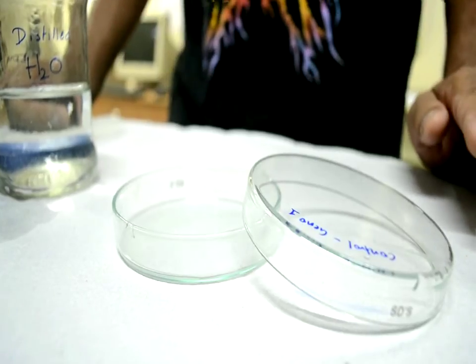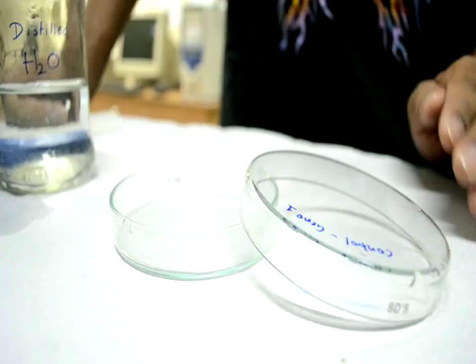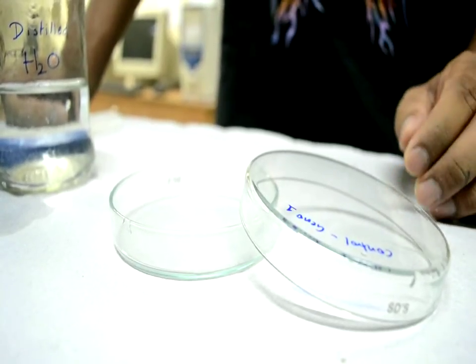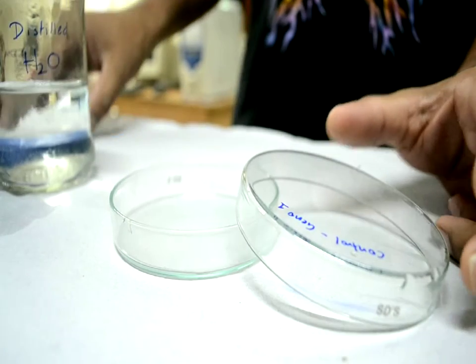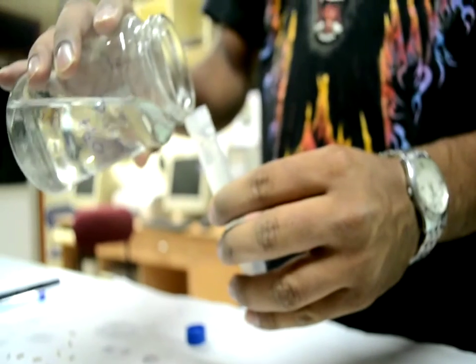The whole experiment consists of three major steps: the first step is sowing, the second is measurement, and the third is harvest. For sowing, the petri plates are initially taken and labeled with appropriate genotype or line numbers, and then a measured quantity of water or NaCl solution is filled in.